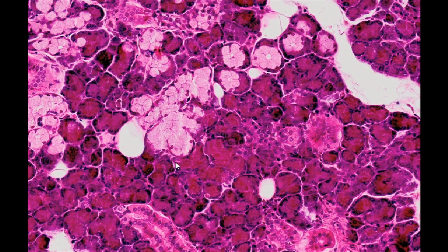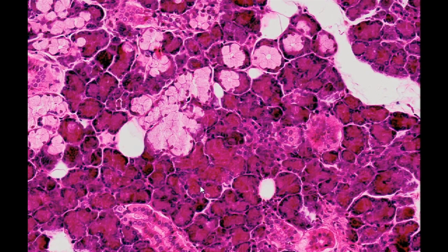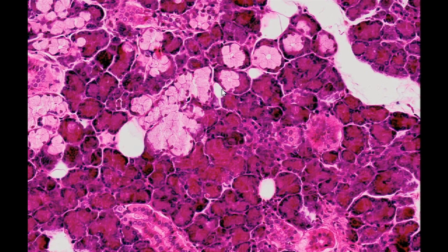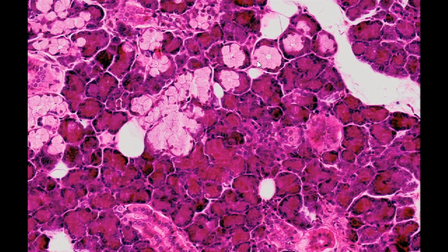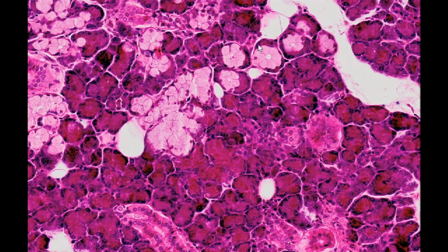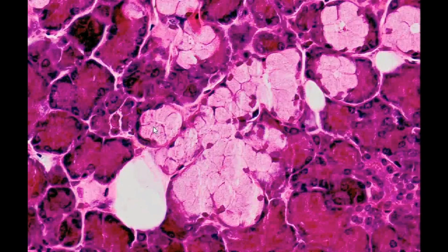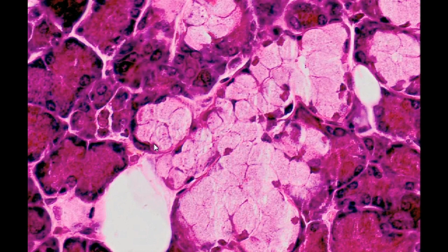The H&E stained specimen shows purely serous, purely mucus, and seromucus secretory units, composed of a mucus tubule and a serous demi-lune. The latter components are very well developed and therefore distinct.